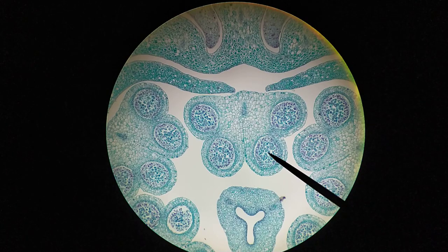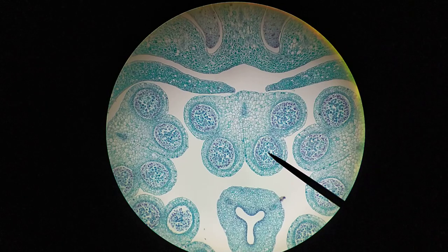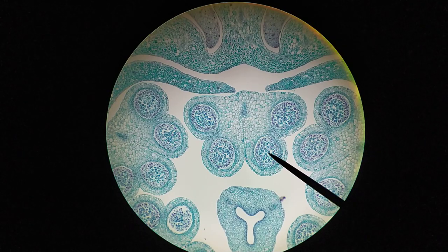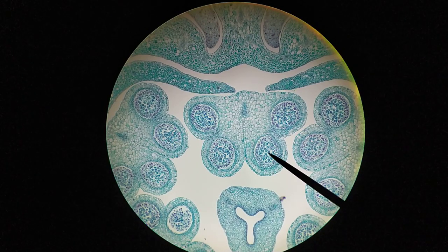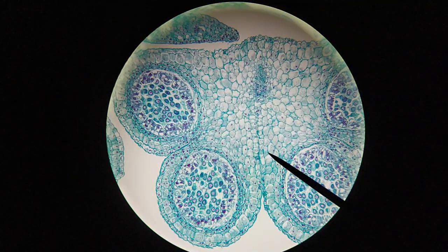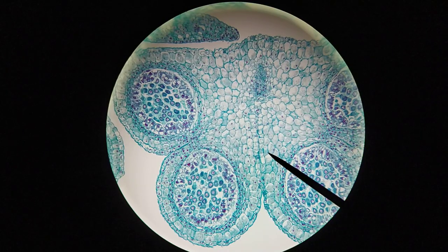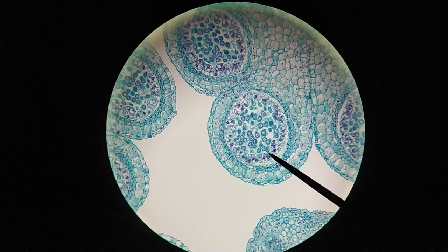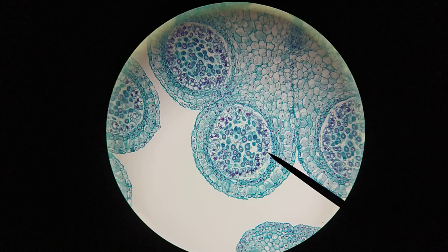Prophase I tends to be very common on meiosis slides, and beyond that you may see a few other stages but not all of them. I'm going to zoom in and go to high magnification. I've started at 40x total magnification and I'm switching over to 100x so you can see more of the anther, and then we're going to focus in on one of these locules. I'll move that to the center and go to 400x.